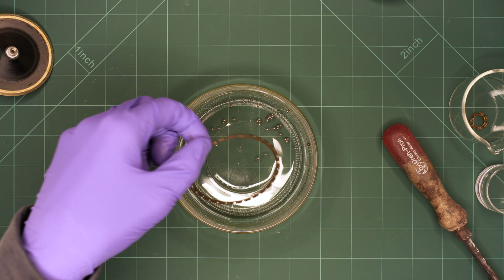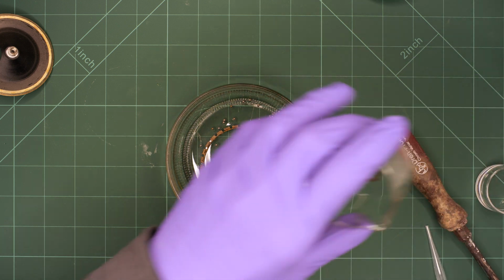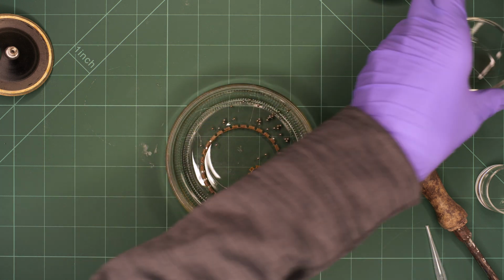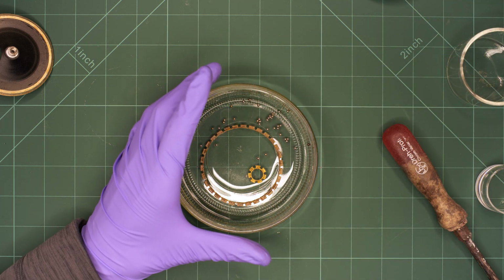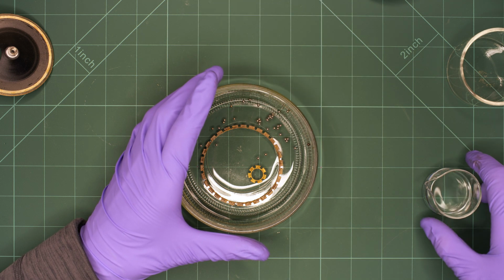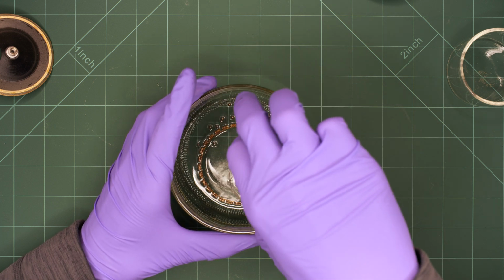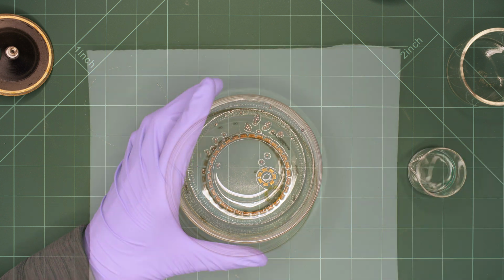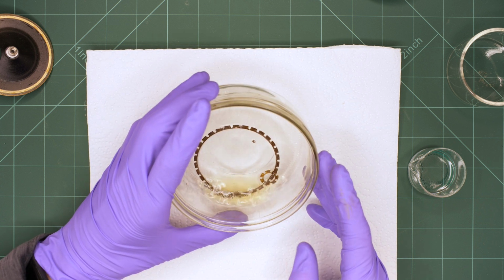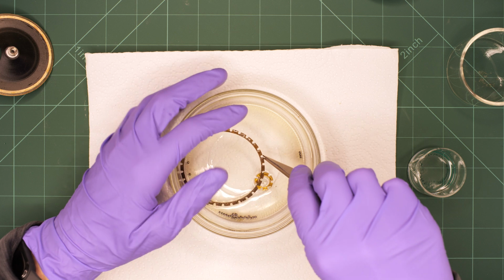The ball bearings and brass rings will now be degreased using a petroleum distillate, often called white or mineral spirit. It is a common solvent and paint thinner found in hardware stores and much better than ethanol or isopropanol. After letting it sit for a while, we can see that the solvent already did a good job in removing most of the old grease. The brass rings will now get some additional scrubbing.